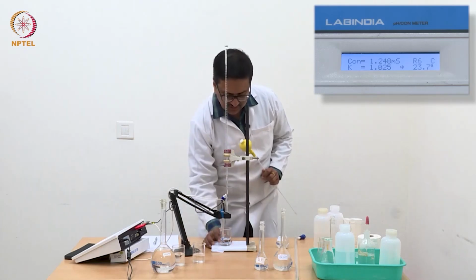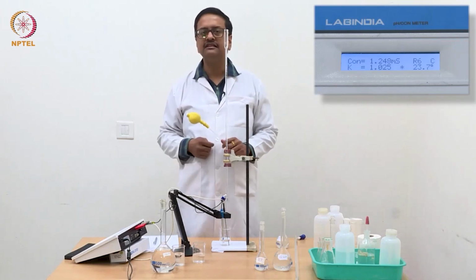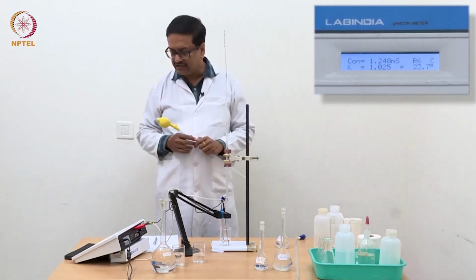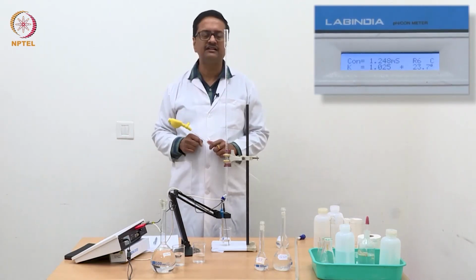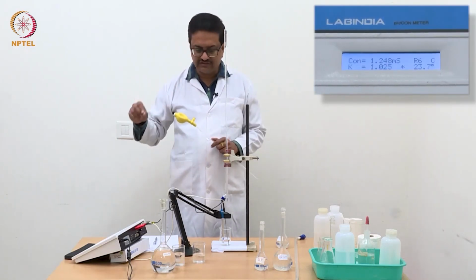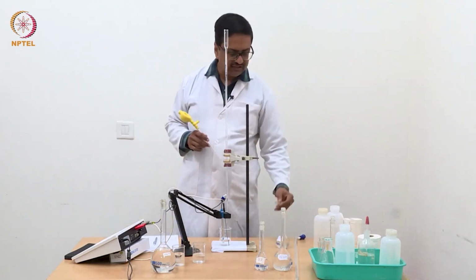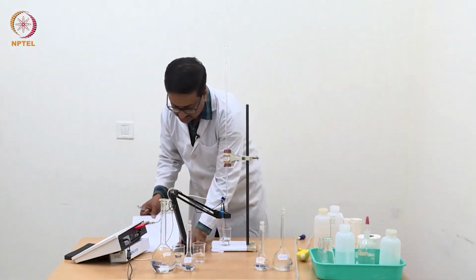You remember that the water that I have added is actually reducing the conductance of this HCl solution, but since this is a method of titration and we are going to measure the change in conductance, the initial starting conductance with water will not matter. If we add a little more water, you will see a change in conductance, but that will be our starting conductance from which we will start adding NaOH and continuously measure the conductance value till we reach the end point.